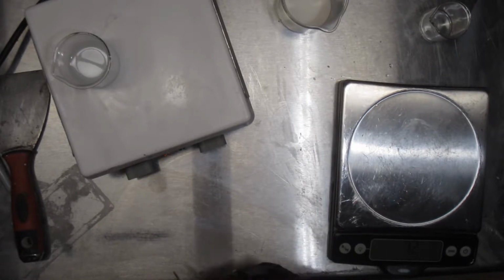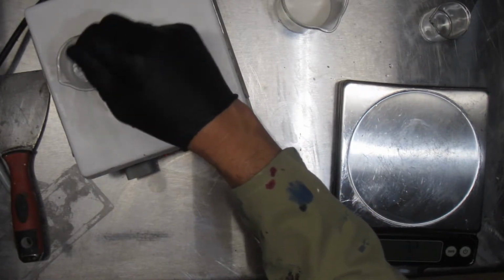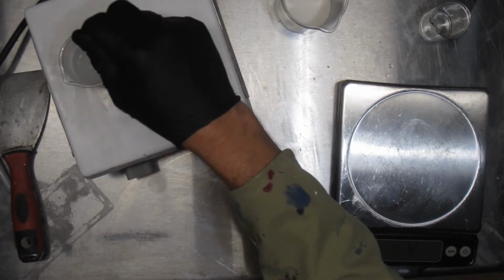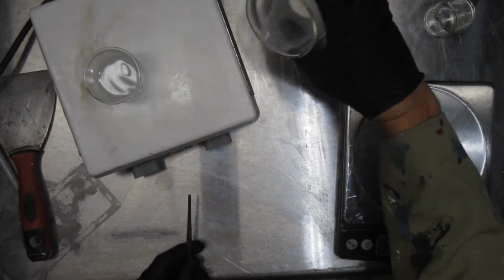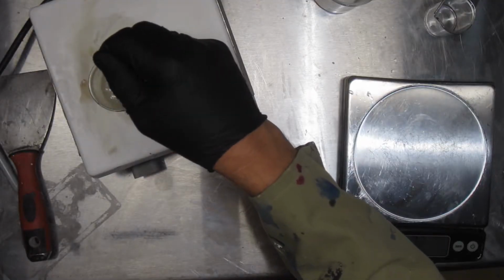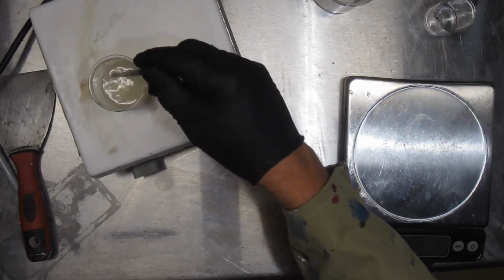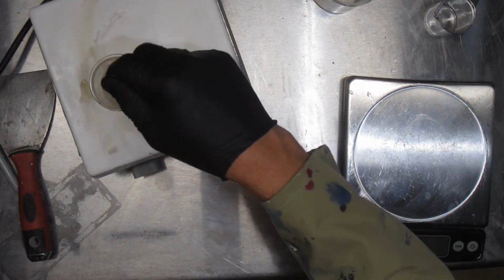Get that dissolved again. This time we're going to be much more careful adding our silica gel. Much more careful. Okay, let's do it. A wee bit at a time. Yeah, so that's clearly not laboratory grade silicon dioxide. Oh, it looks foul.